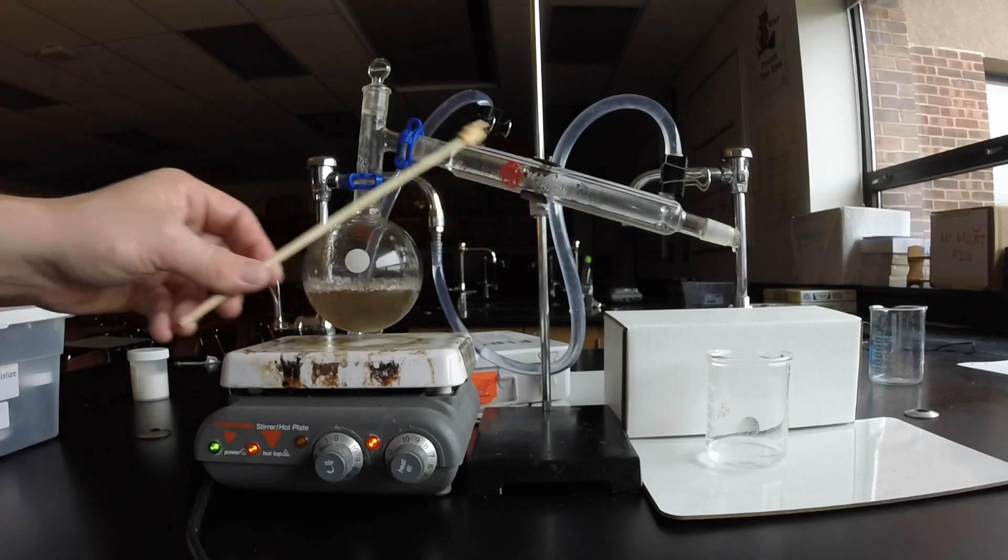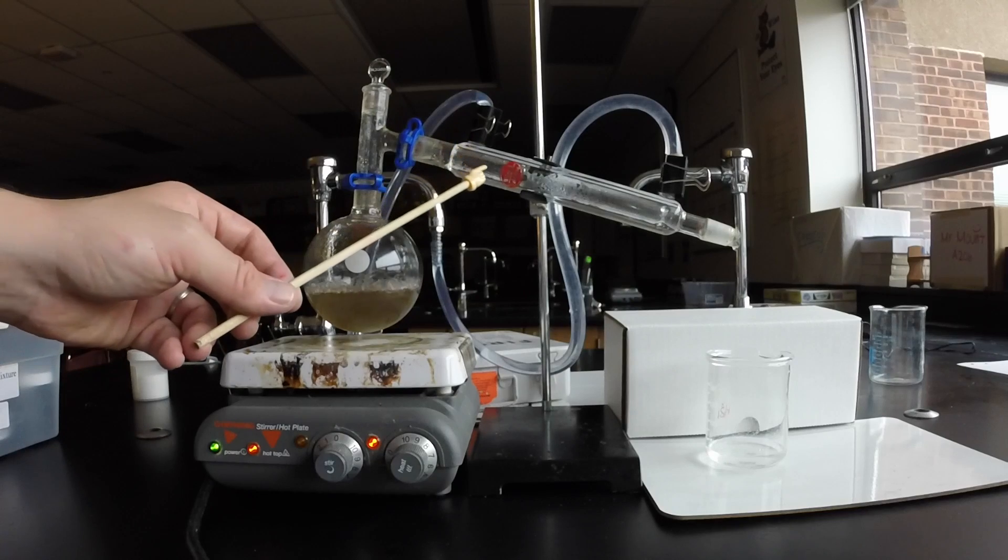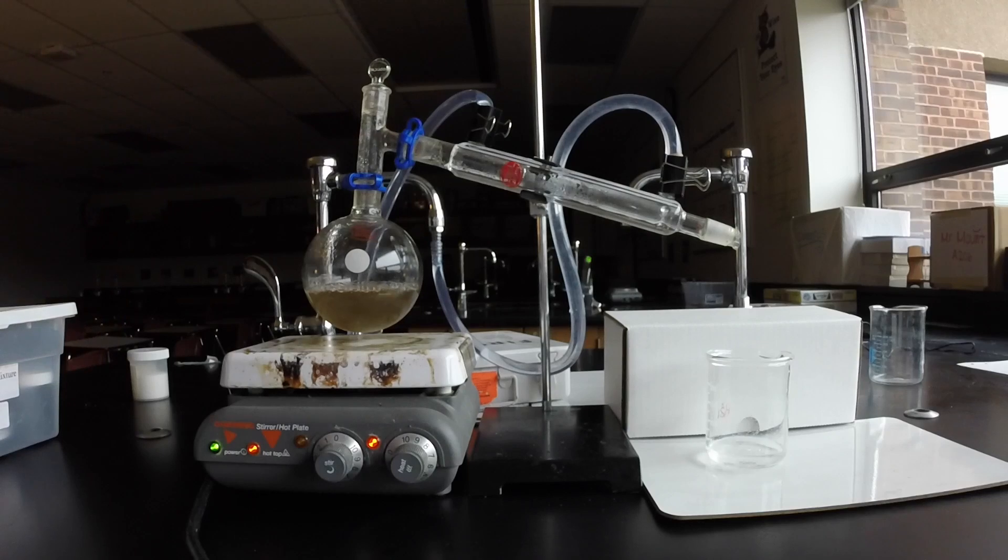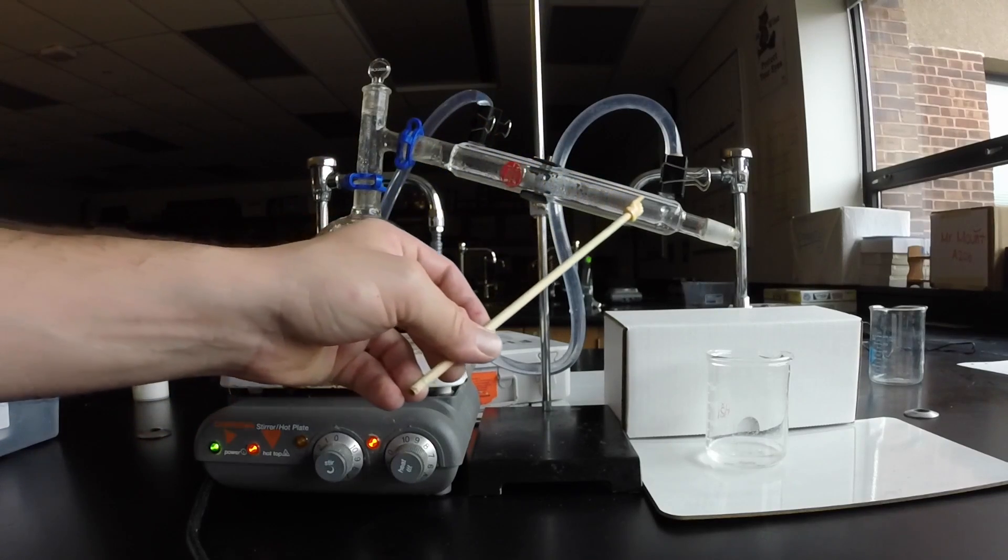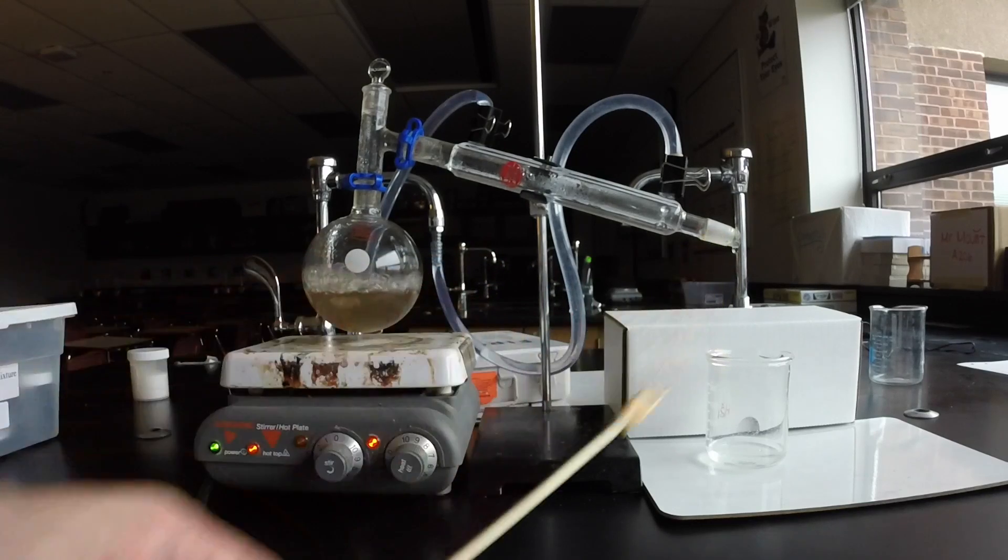That's water vapor boiling from the boiling flask. Finally, what happens then is when enough water accumulates, or whatever the solvent is that you're evaporating, it then runs down the condenser and drips into your collection container.